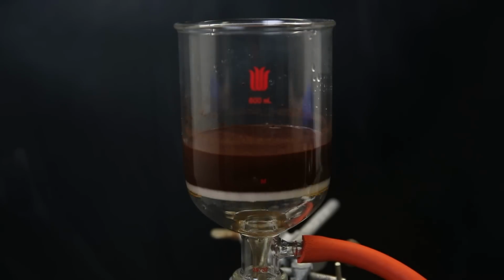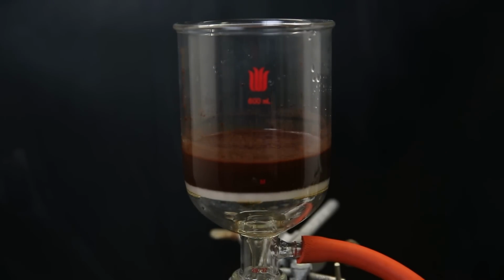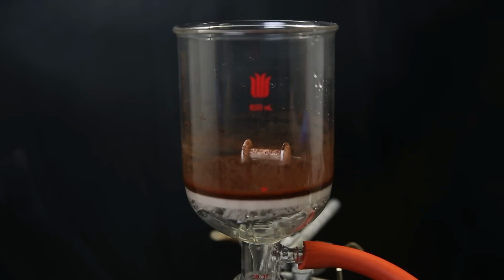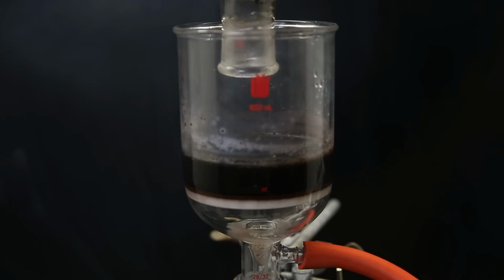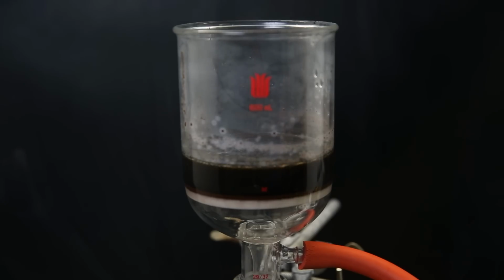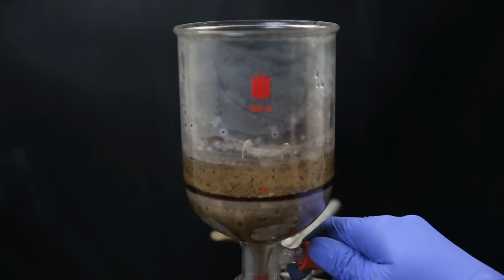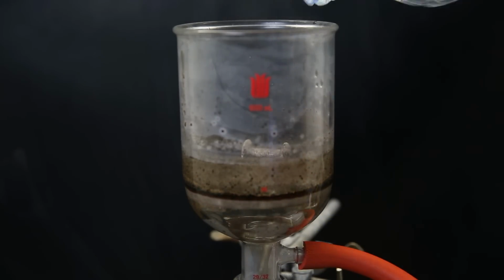I then take the mixture and set it up for vacuum filtration to remove all of the catalyst. I then wash the flask with concentrated hydrochloric acid to destroy the catalyst that is sticking to the flask, and also free product that might be trapped in there. The product can also chemically stick to the catalyst. So I just destroy the catalyst on the filter with concentrated hydrochloric acid and let that mix with the same filtrate, which will also destroy any catalyst that came through.